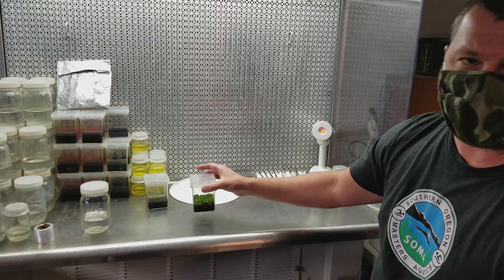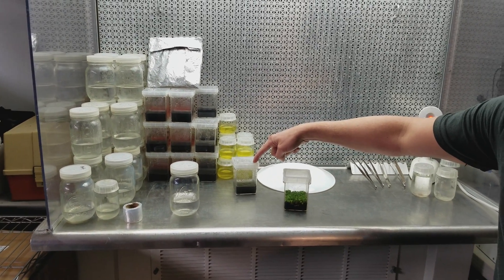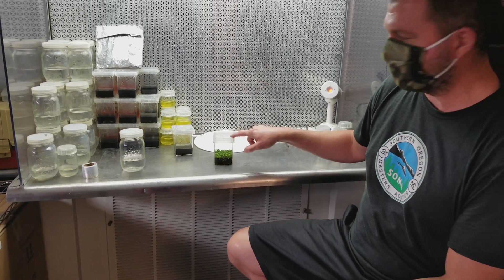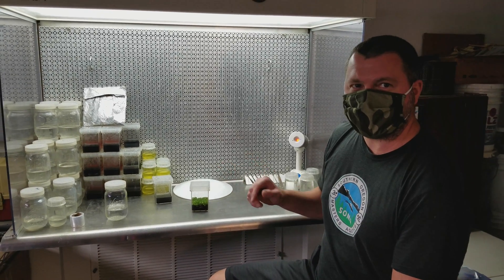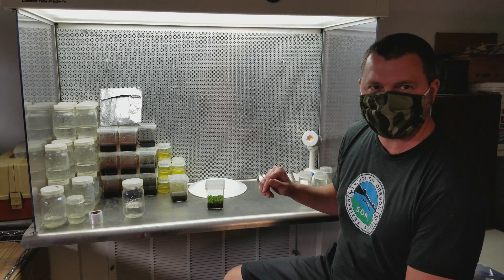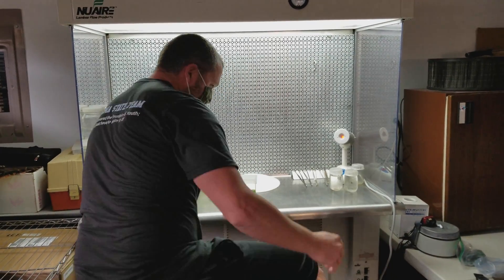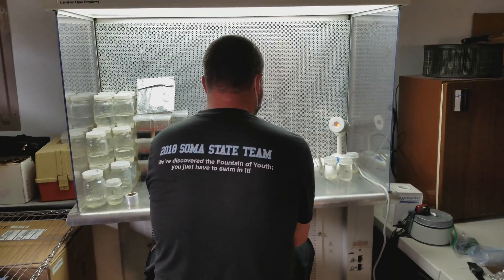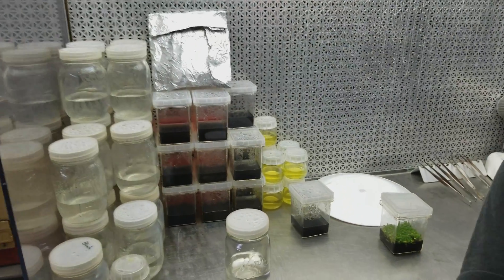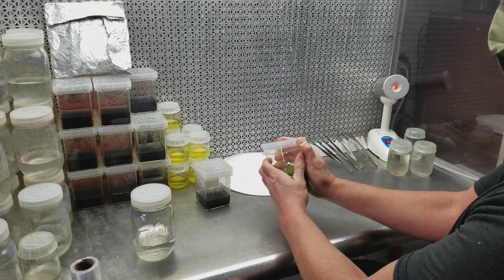All right, I'll start the replate here. Basically all I'm going to do is pull out pieces of tissue, rinse off the media that sticks to them in the sterile water, and then put them down in the new flask. It'll probably take me two or three flasks when I start separating all the little plants. Leah calls me the mad scientist of fly traps and carnivorous plants.